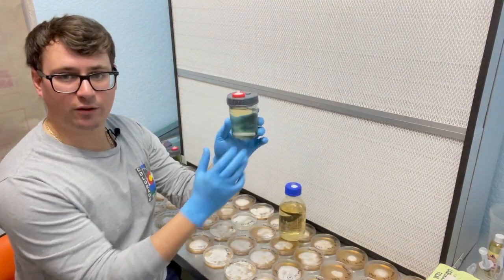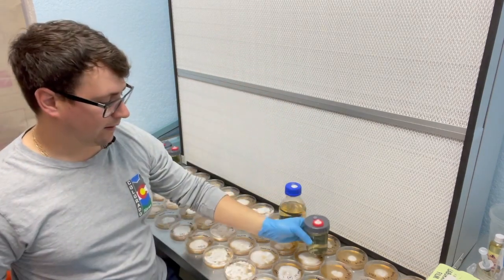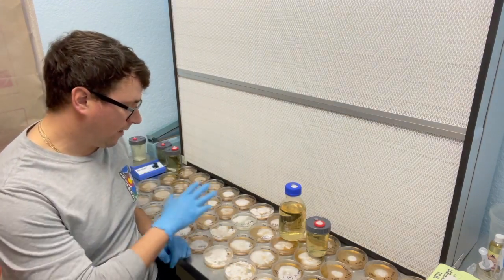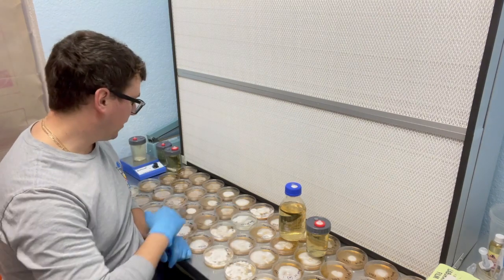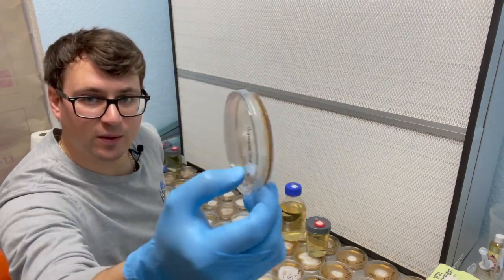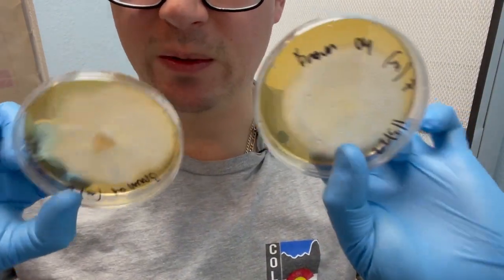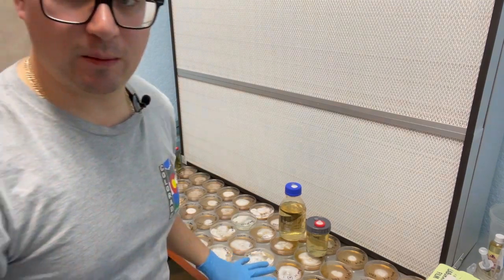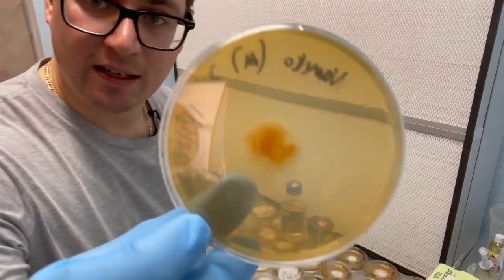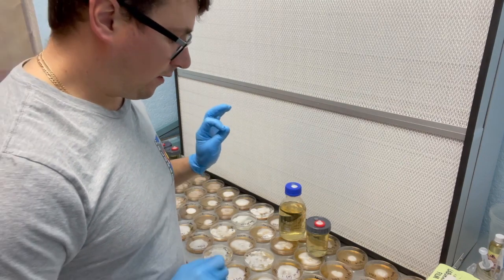These broths have been cooling for about five days now, so I know they're sterile — they're very clear with no growth inside the media bottle. There are two ways you can go about doing this. I'm going to try to select one of the better-looking cultures. This is a brown oyster and you can see after just a few days it's almost covered the petri dish. These are really good examples of mycelium cultures I'd want to put into liquid culture. I'm trying to select for the most vigorous strains — this nameko is pretty slow by comparison.